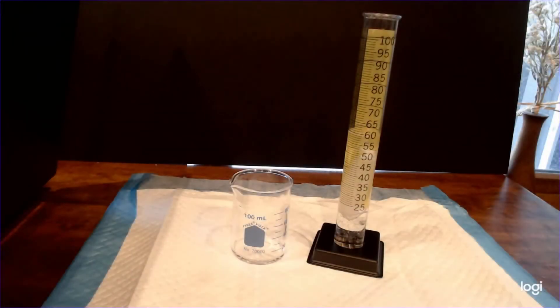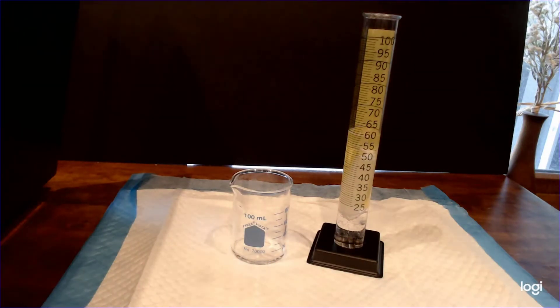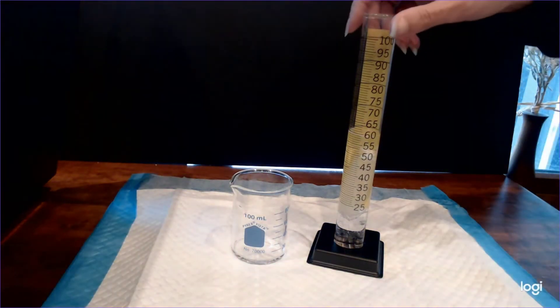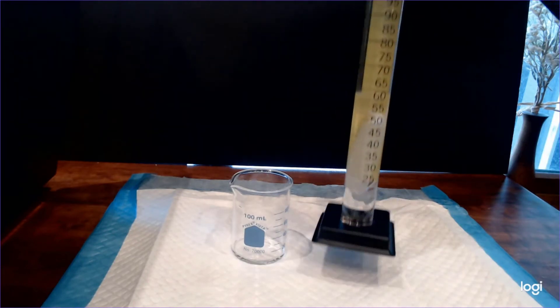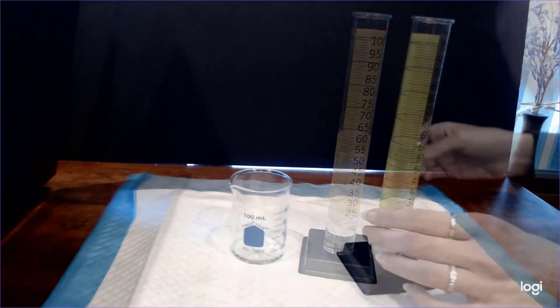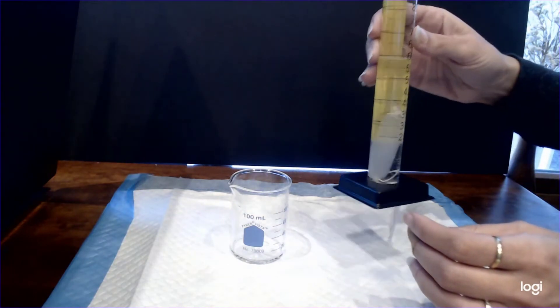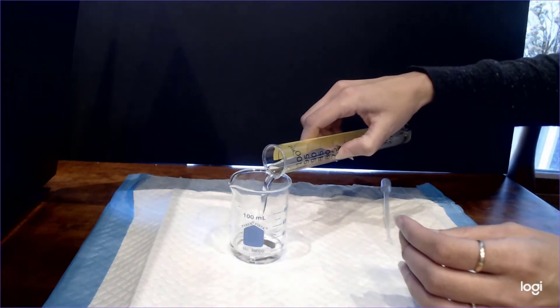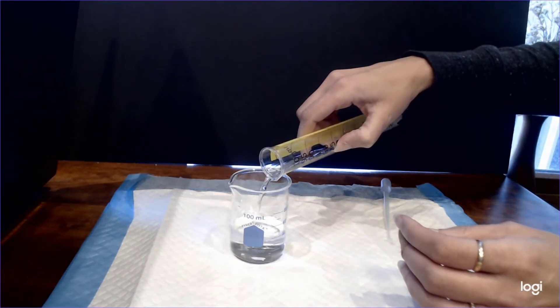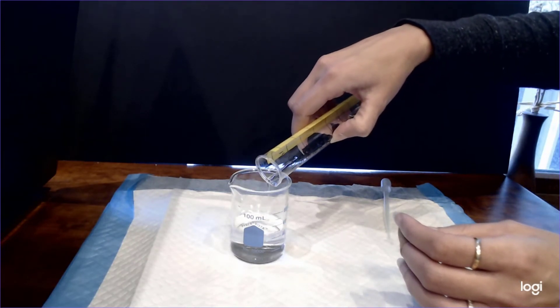After your hour and a half incubation it is time to analyze both the dialysis bag and the solution around the dialysis bag for evidence of diffusion and osmosis. I found that the easiest way to get the dialysis bag out and actually work with both solutions, both in and out of the bag, is to pour everything into a beaker as shown.